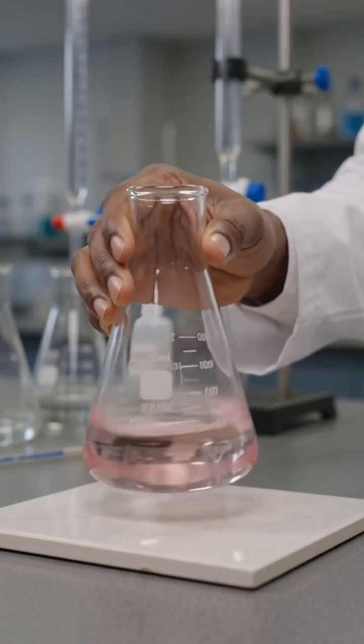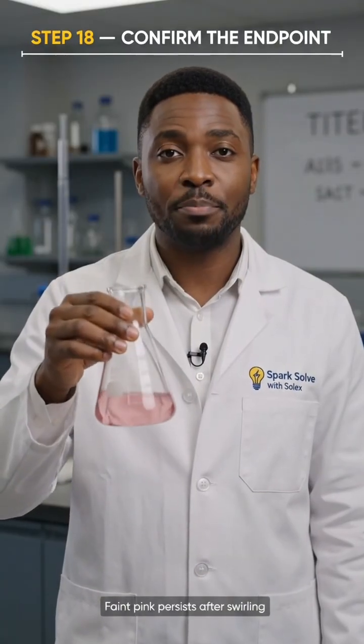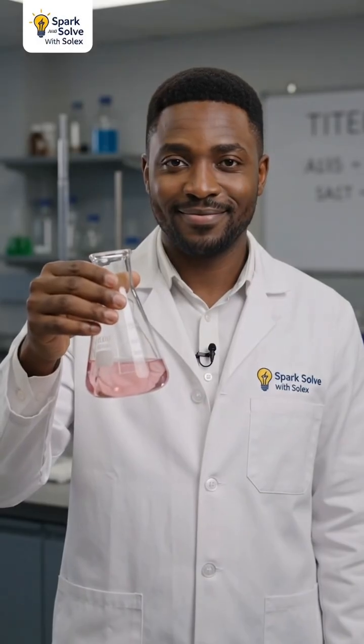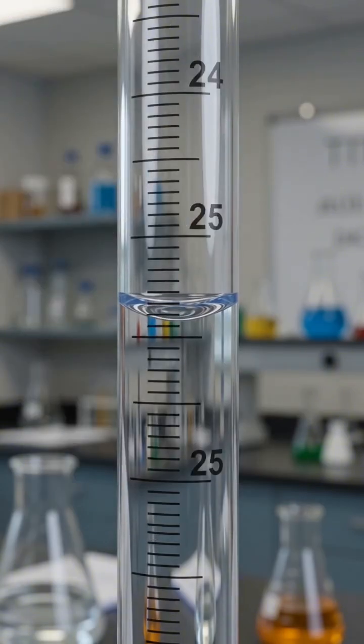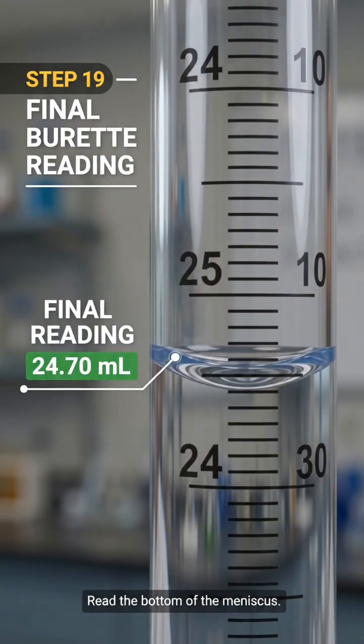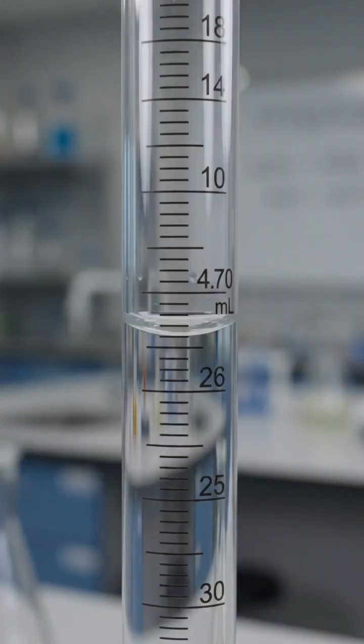Swirl gently and confirm that the faint pink color persists. This confirms our endpoint. Now read the final burette volume at eye level using the bottom of the meniscus. Our final reading is 24.70 milliliters.